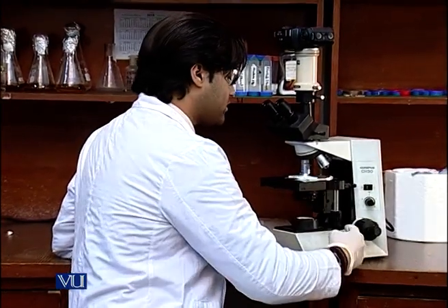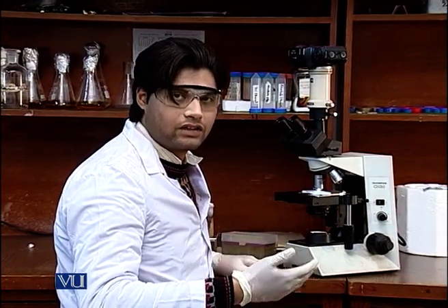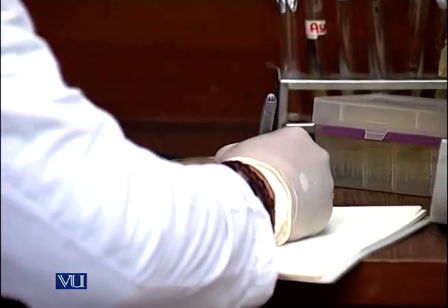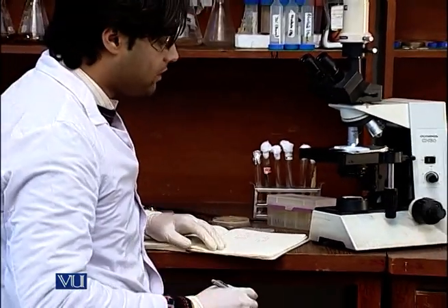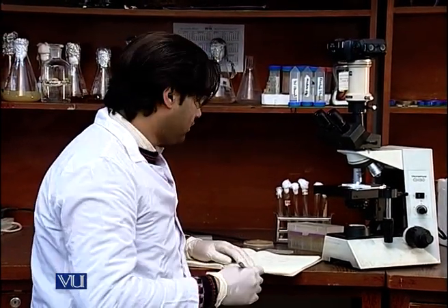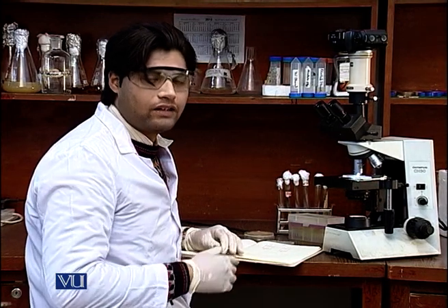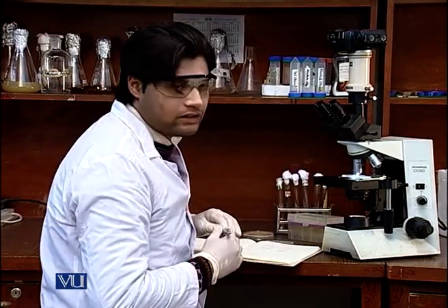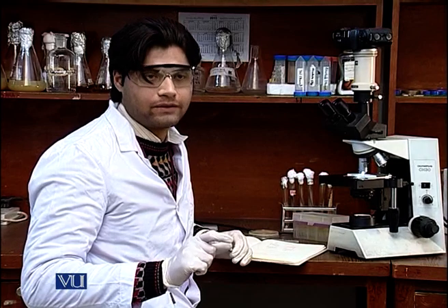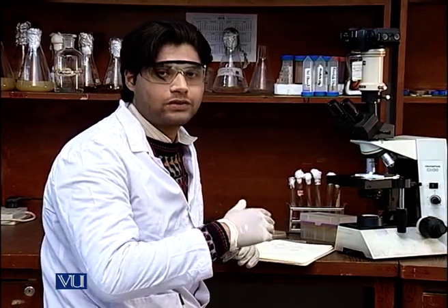Once focused, I will look at those squares one by one and manually count all the fungal spores in each chamber. I have focused the hemocytometer chamber at 40x and started counting in each box. I will use the four corner boxes as my reference for counting fungal spores. At 40x in one microscopic field, you will see one of the 16 sub-boxes in one corner square, and you count the fungal spores in each of those 16 sub-boxes one by one.